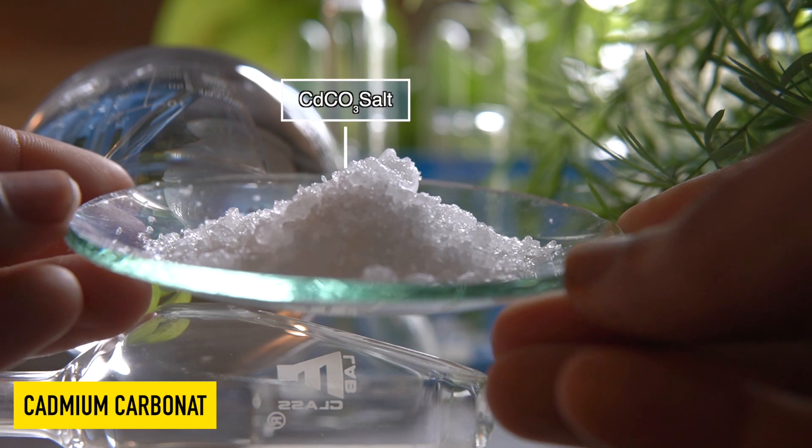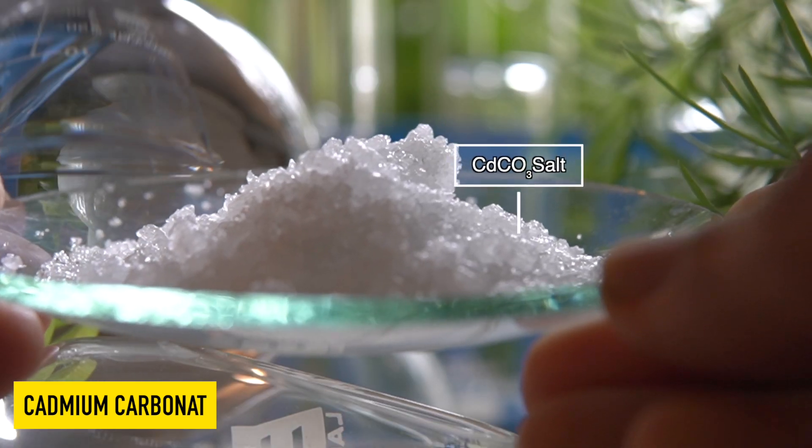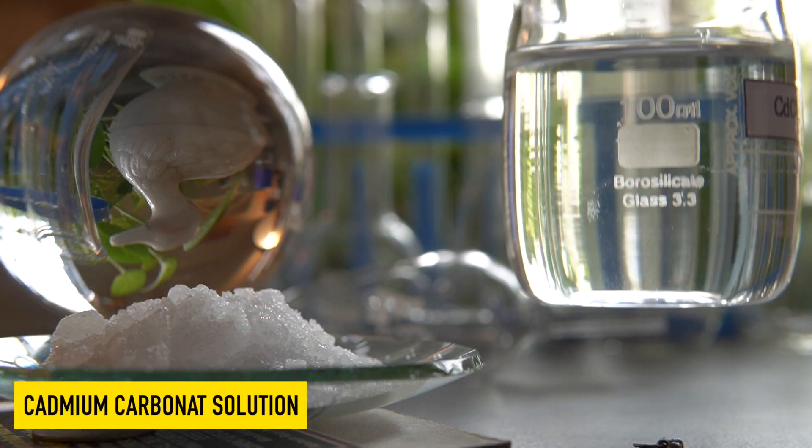This is cadmium carbonate, a white crystalline salt that is slightly soluble in water to make a transparent clear solution.